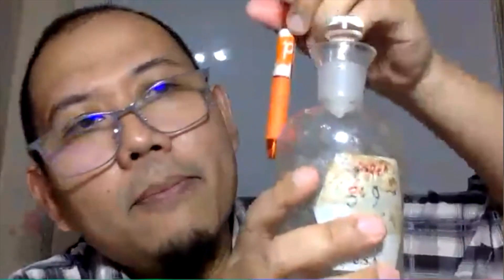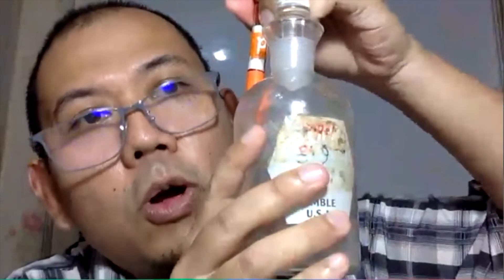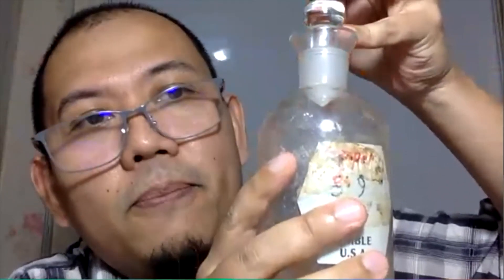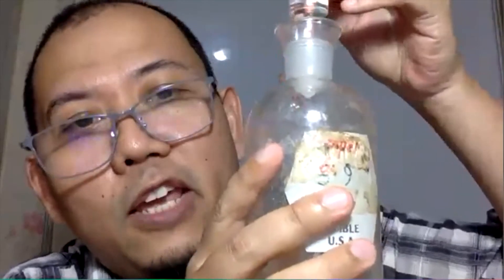Then you put the stopper back. These BOD bottles need to be placed inside your incubator at 20 degrees Celsius. After 5 days, you come back, open the incubator, take it out, open the stopper, and start measuring the DO — that will be the DO five, the dissolved oxygen on day five.